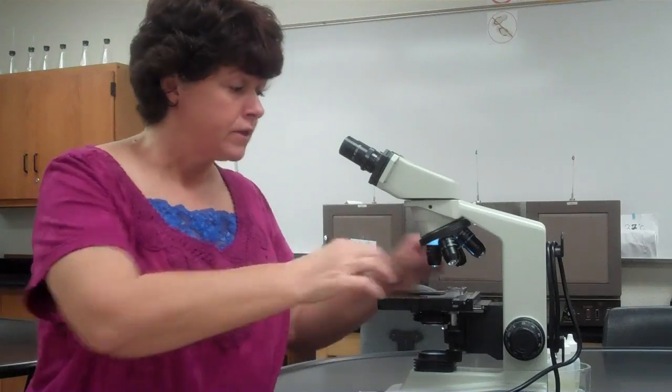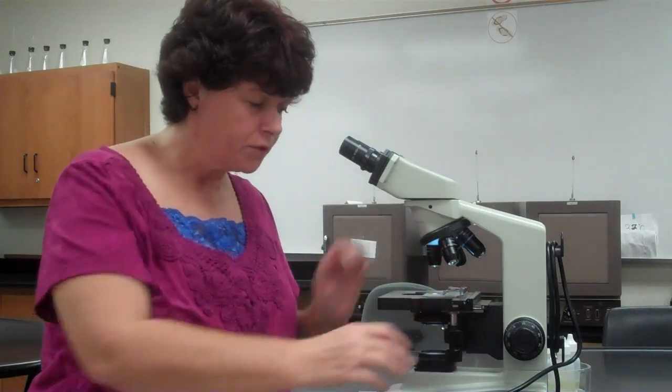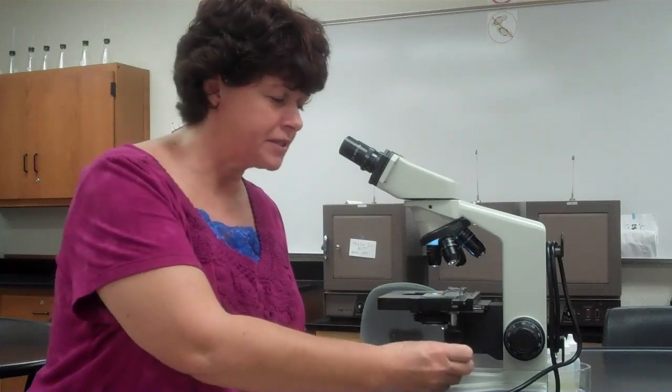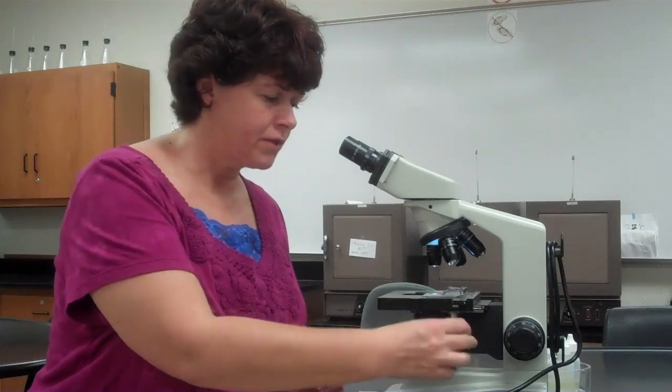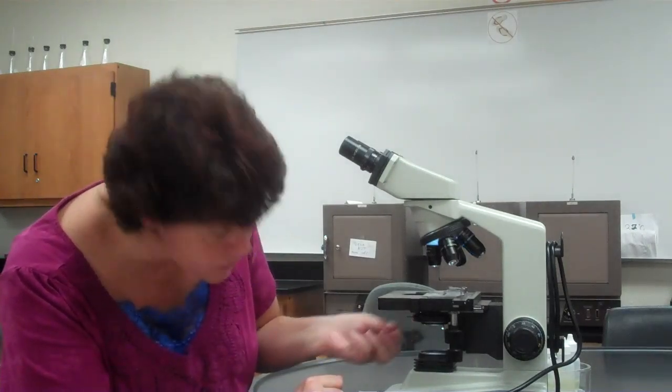So when we put it on the microscope, you put it in that clip, you put it over the light source. So if it's not centered, you're going to move it over the light source. One of the other things that I noticed right away is the light is really bright. Under the low powers, I'm going to want to turn it down. So I'm going to use the diaphragm lever and I'm going to close it a little bit by moving it to the right to kind of cut down on the light.